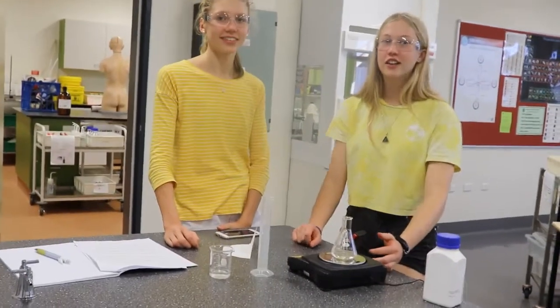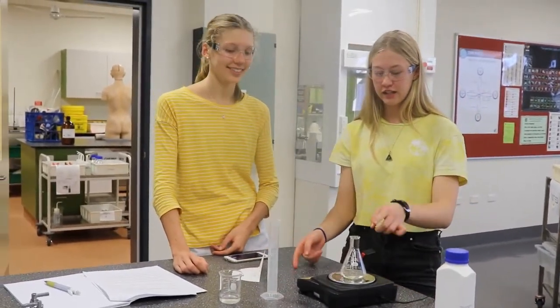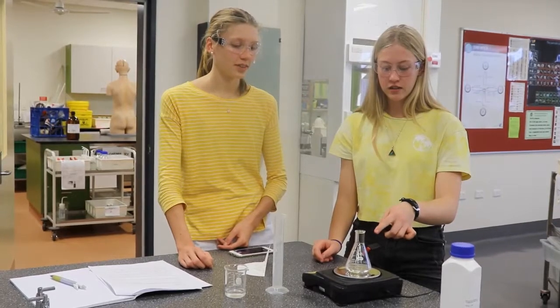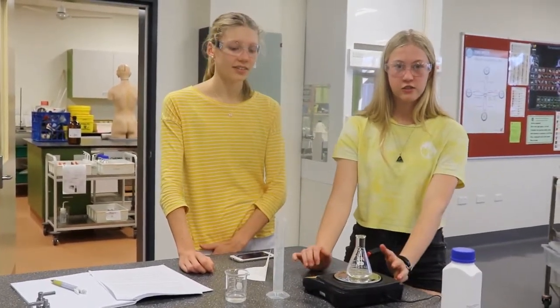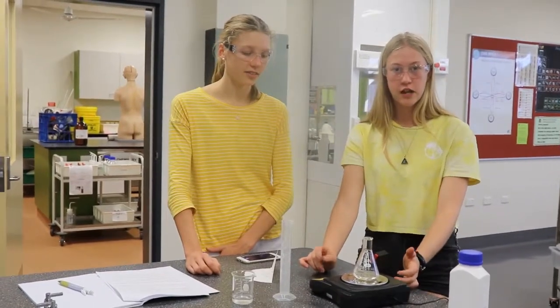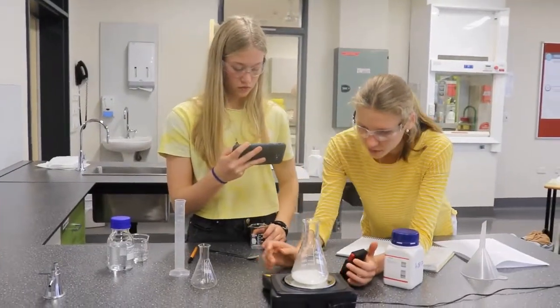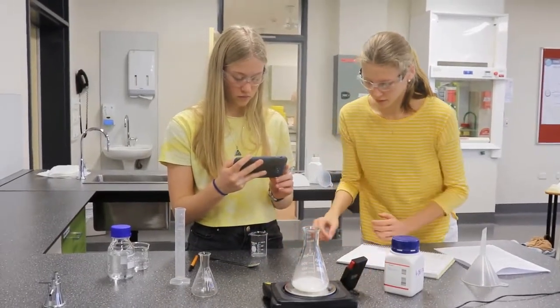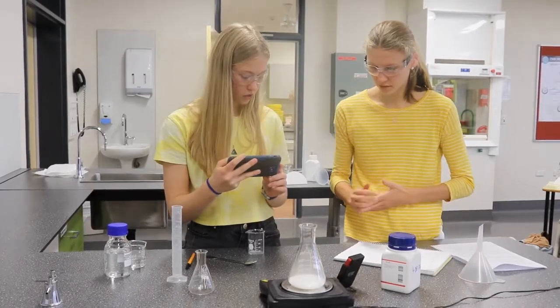Rolling already? Oh, okay, so Samantha's going to put the calcium carbonate into the conical flask. I'm going to set it to 0 and press start at the same time, and she'll start recording. There's like 1 chip here. Oh, that wasn't calculated. I don't know where that came from.